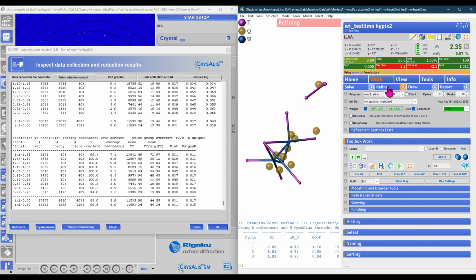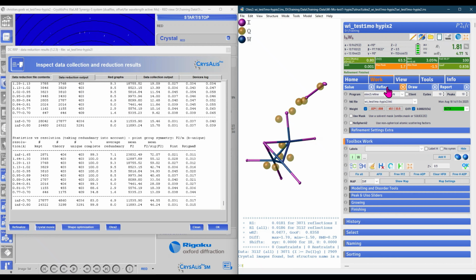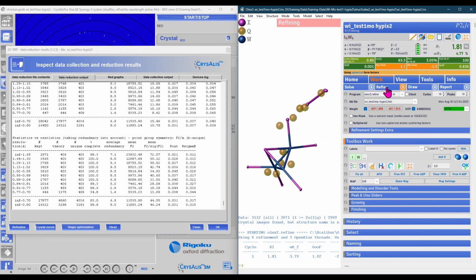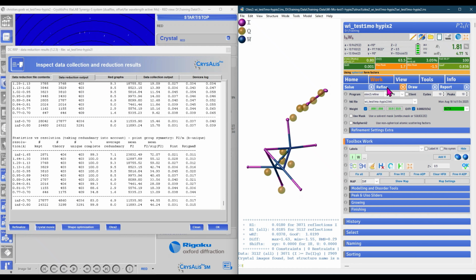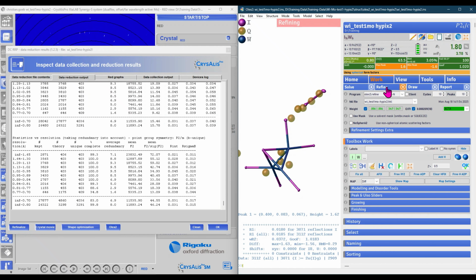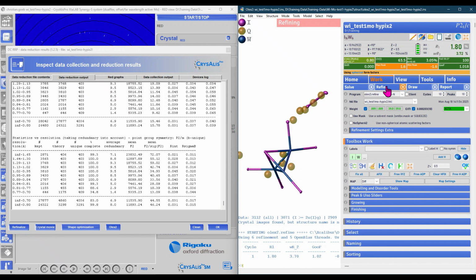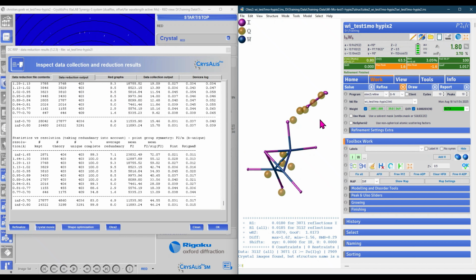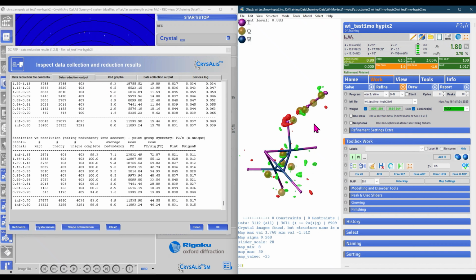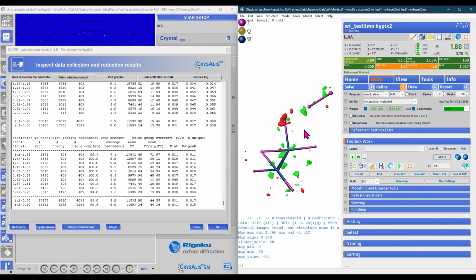If we refine now on this newly scaled HKL, you can see that also the R1 has been drastically improved, so has the residual electron density. We will refine now until no more shift can be observed, and then we can have another look on the residual electron density map. You can see that it has been cleared out much more, and we can even see some distinct features of this halogen bonding.